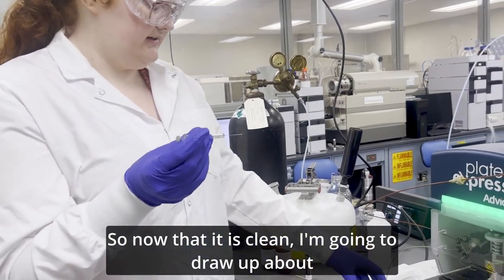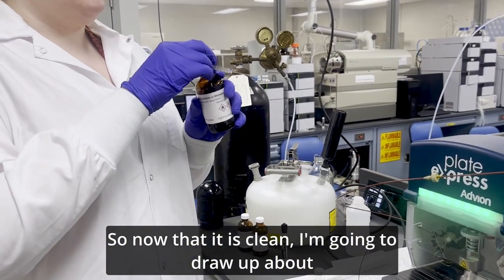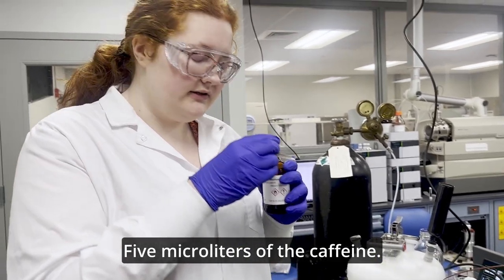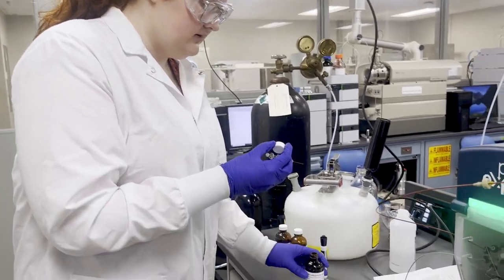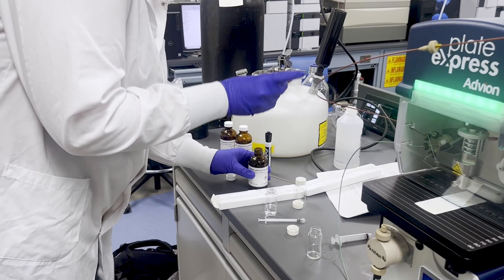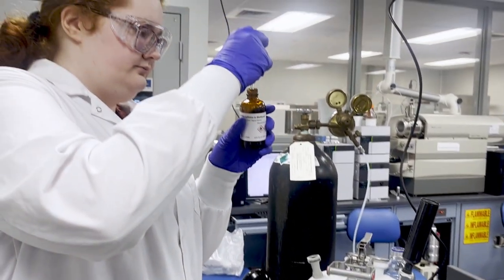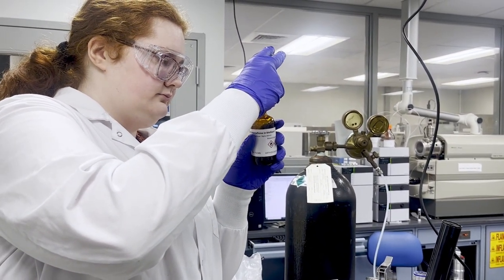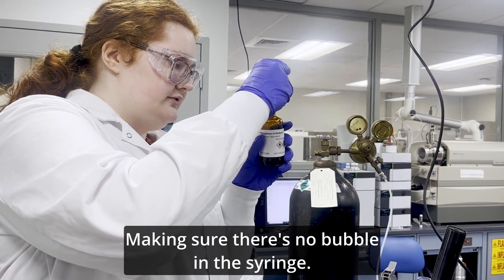So now that it is clean, I'm going to draw up about five microliters of the caffeine. Making sure there's no bubble in the syringe.